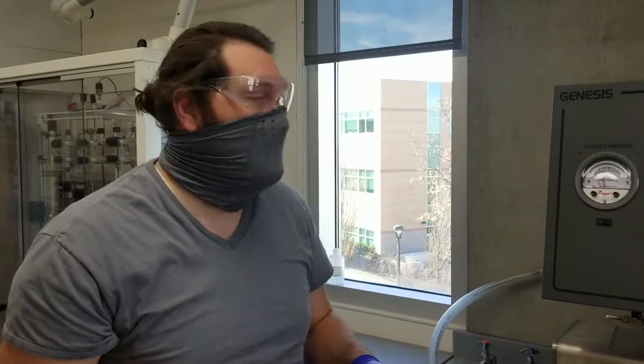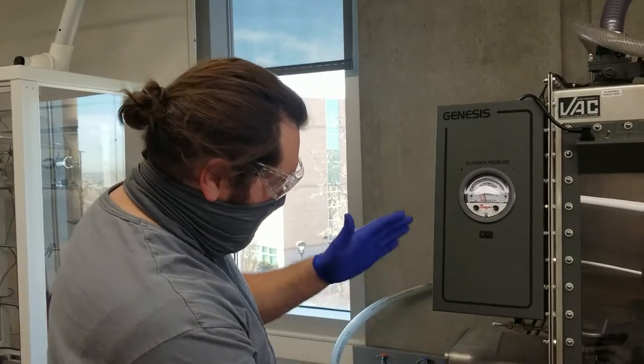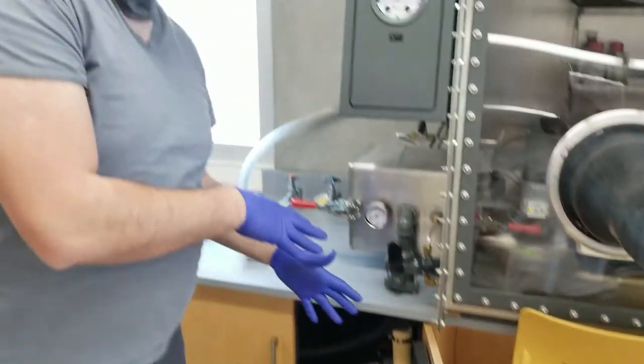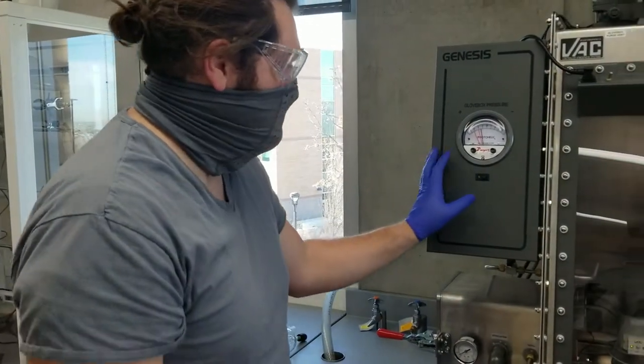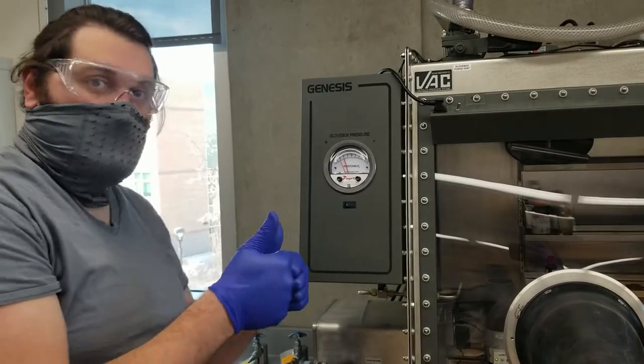Or at the minimum, sorry, at the minimum. You can obviously let it run for longer to make sure that anything that's caught within the line between the glove box and the pump is taken care of. Now we just barely turned this off to show this as a demonstration, so we're now going to turn this on. You just press this, turn on and you're good.